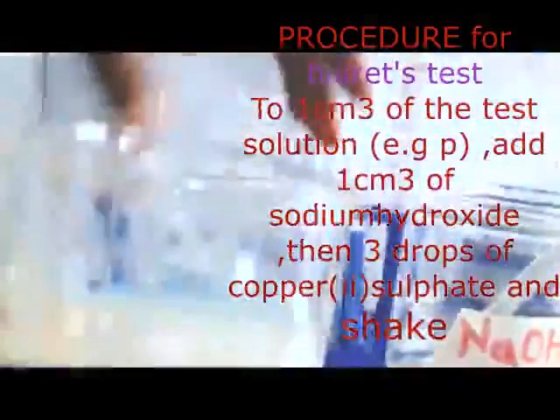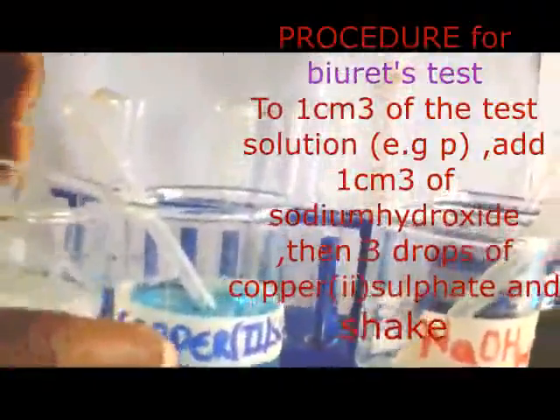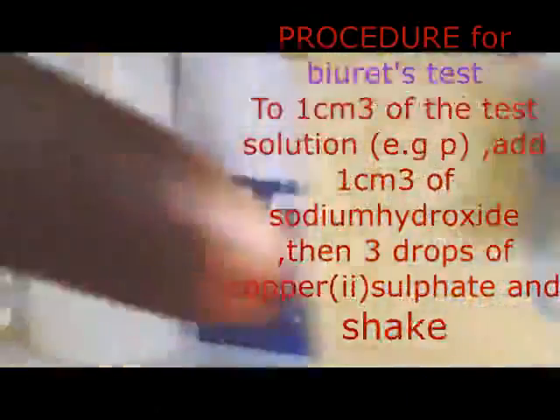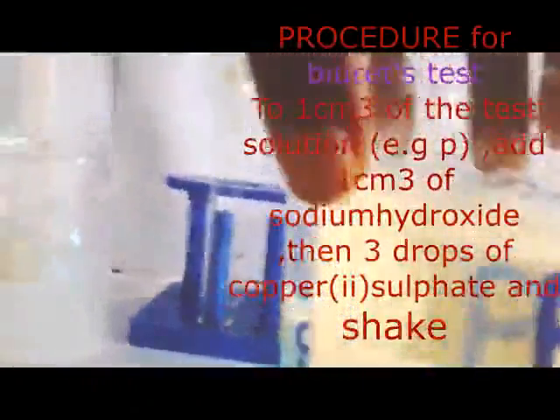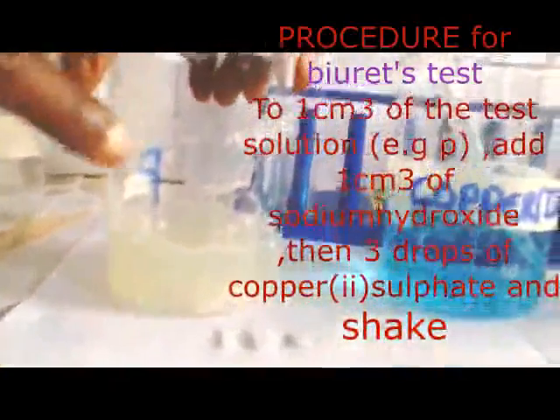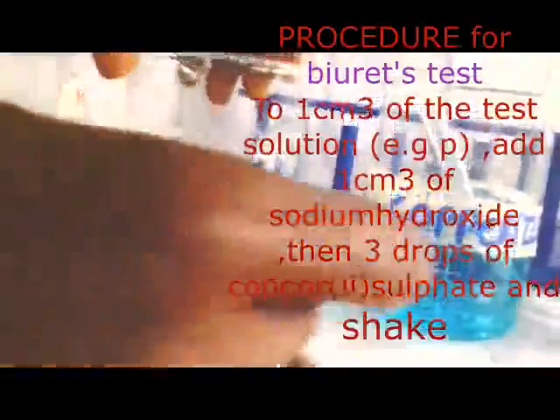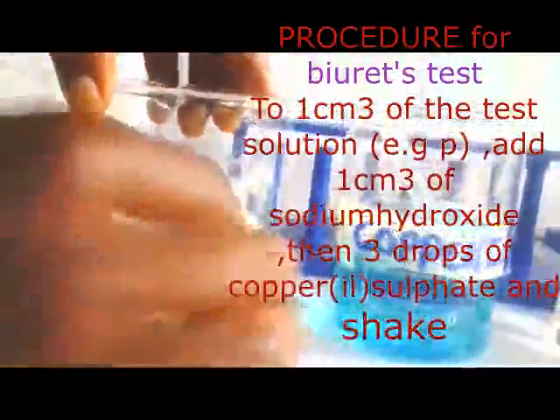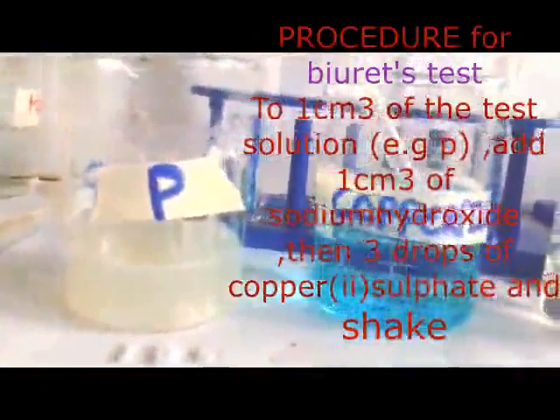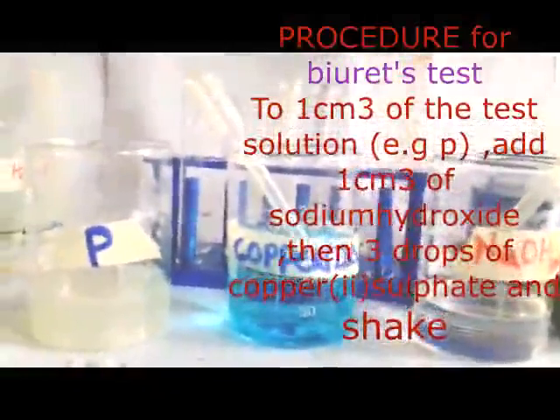Now members, this solution here is the solution which we are going to use for our protein test. When you look at that solution, I've now called it solution P. This is my resultant solution after putting my egg albumin. So egg albumin is one of the sources of proteins. Now my solution P, I'm going to use for what we are calling the Biuret test, or protein test.